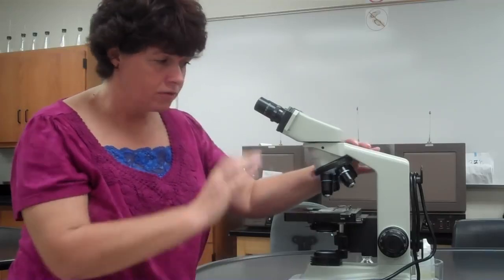So now you've done all the right things. You have it under the 100. It's good and focused. You can find it. It's really important that you don't give up on this, okay? You need to make sure that you can find the correct specimen. You're going to see a lot of stuff on there. You may see big blobs of stain. One of the rules to keep in mind is bacteria is very, very, very tiny.